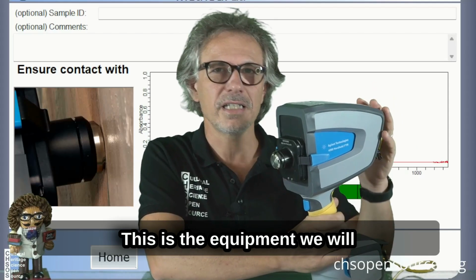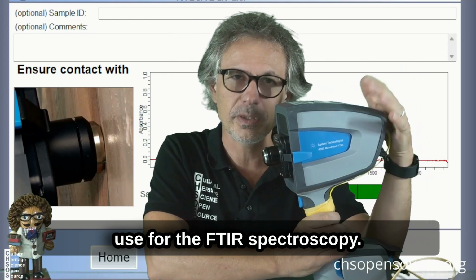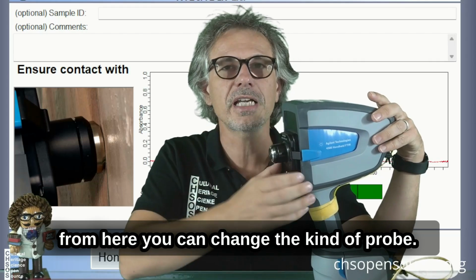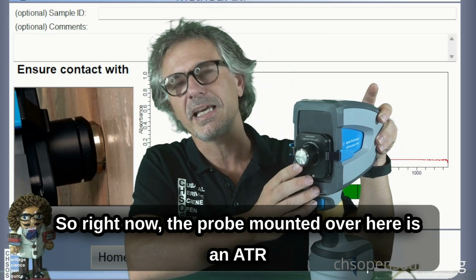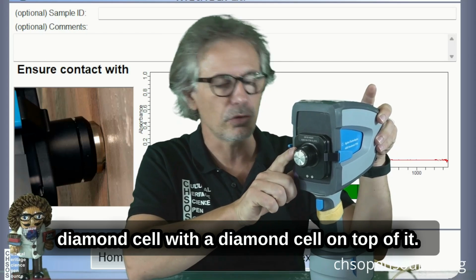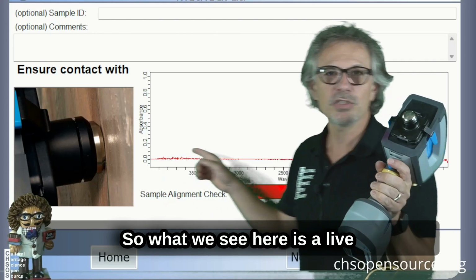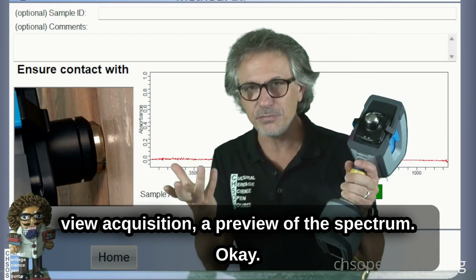This is the equipment we will use for the FTIR spectroscopy. So this is a handheld FTIR system, where from here you can change the kind of probe. Right now the probe mounted over here is an ATR diamond cell, with a diamond on top of it. On my back is the software for acquisition. What we see here is a live view acquisition, a preview of the spectrum.